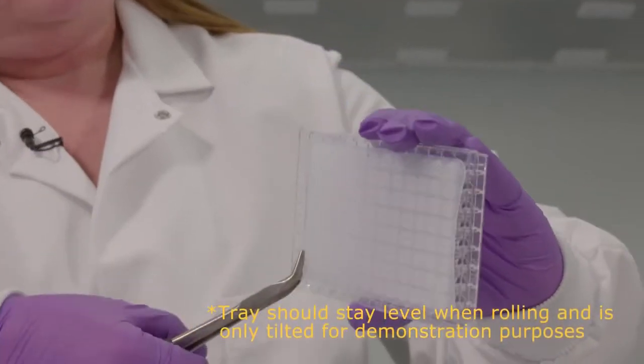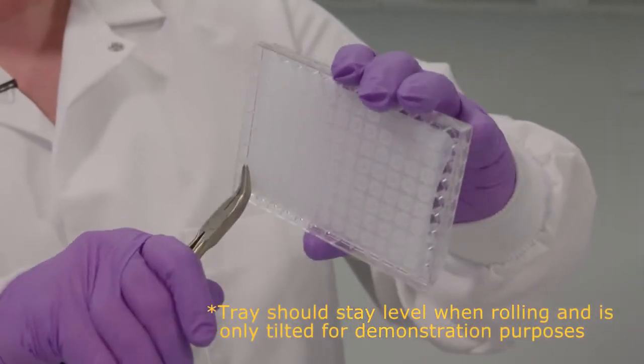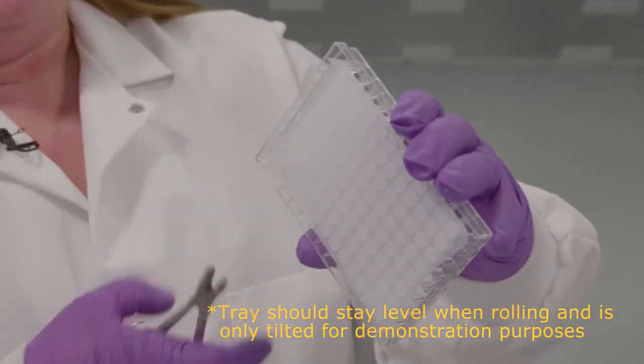With the other hand, use the pliers and grab one corner of the under drain. Pull away, rotate, and roll the pliers to initiate removal.